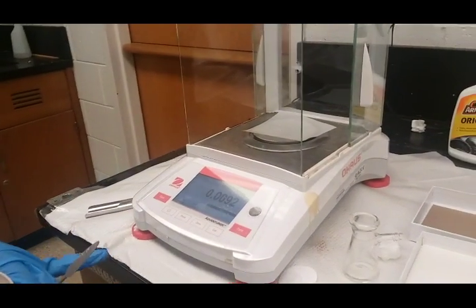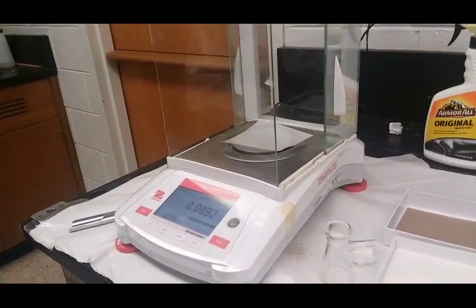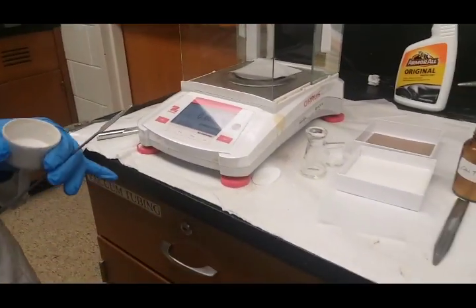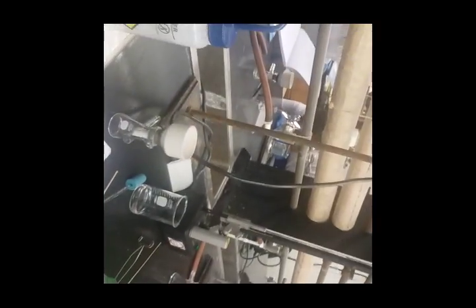You started with 0.63 and you got about 20% recovery is what you're saying. All right, that's not bad. This is the calculation of percent recovery of the phthalic acid and now you're preparing, that's the phthalic acid there.